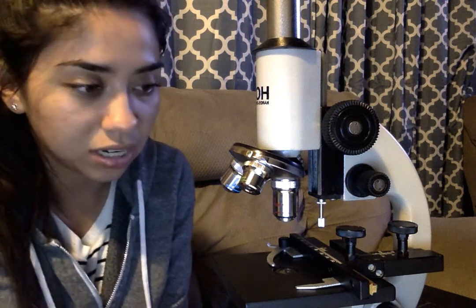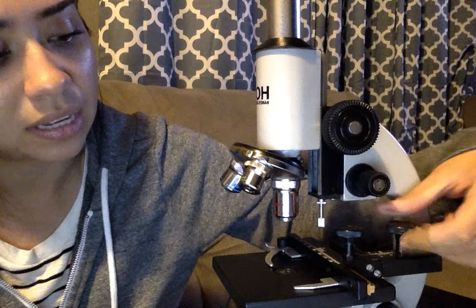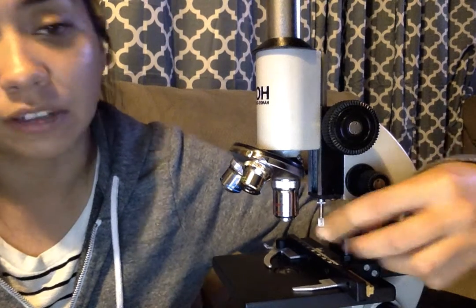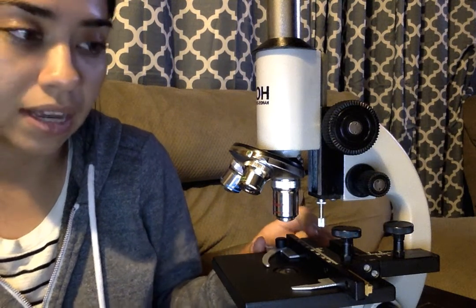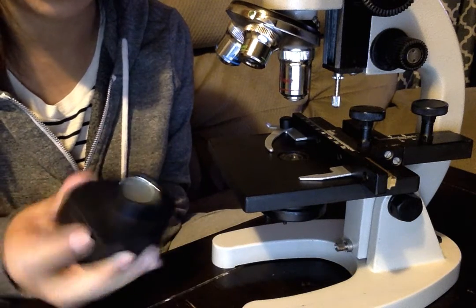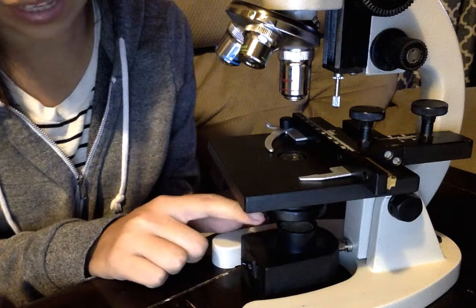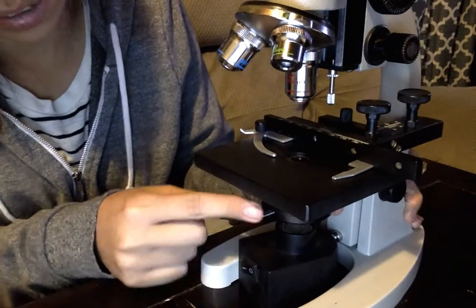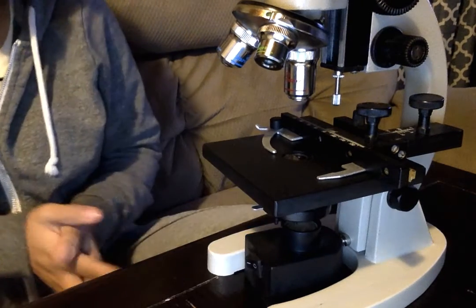We learned how to calculate total magnification in this week's lab. Some other parts on the microscope: these are the stage adjustment knobs — this one allows me to move the slide forward and backwards, while this one allows me to move it right to left. Here we have the stage, and this is the stage clip which holds the slide in place when viewing. Here we have the base of the microscope. My microscope has a separate illumination source, so I have to be careful when moving it. Right above the illumination is the diaphragm — there's a small knob here that allows me to control how much light goes through when I'm viewing different slides.